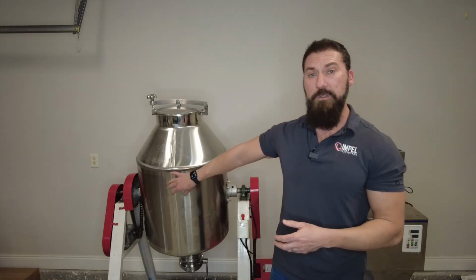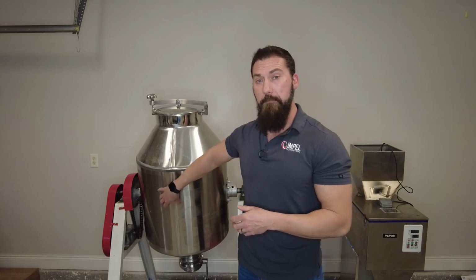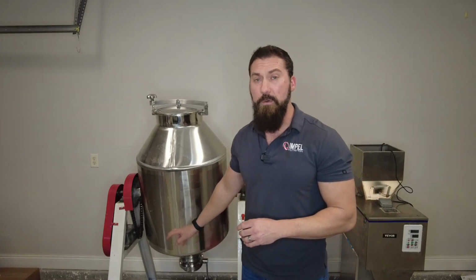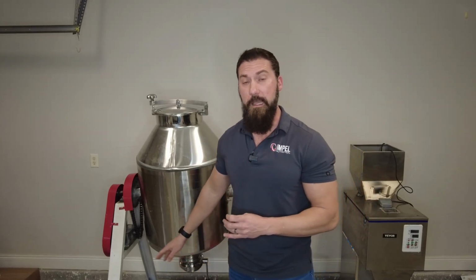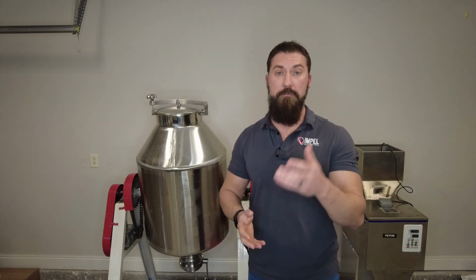So if we're using the thief type probe, what mixture we test may not be the end result coming out of this machine. So you would also do a top, middle, bottom, or a first, middle, last if we're talking out of the discharge nozzle. This way we can look across the mixture if we are maintaining the proper mixture.